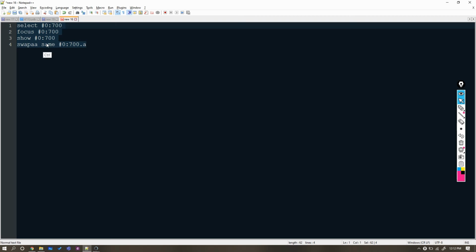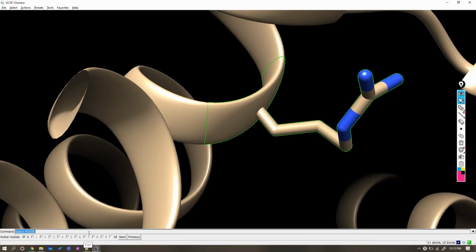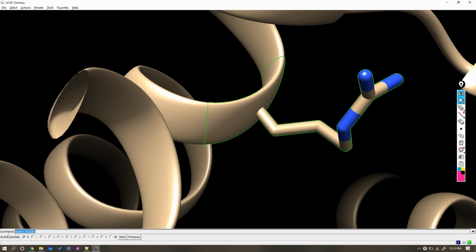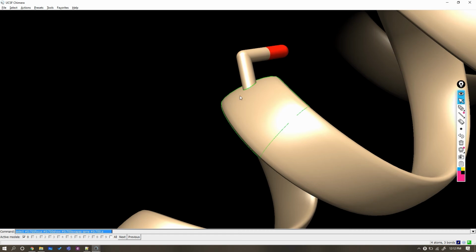Select all the commands at once and copy them. In Chimera, go to Tools, General Controls and Command Line. Here at the bottom you will see the command text box. Clear the previous command, paste the earlier copied commands and hit enter. After a while, you will see residue 700 with everything done already.